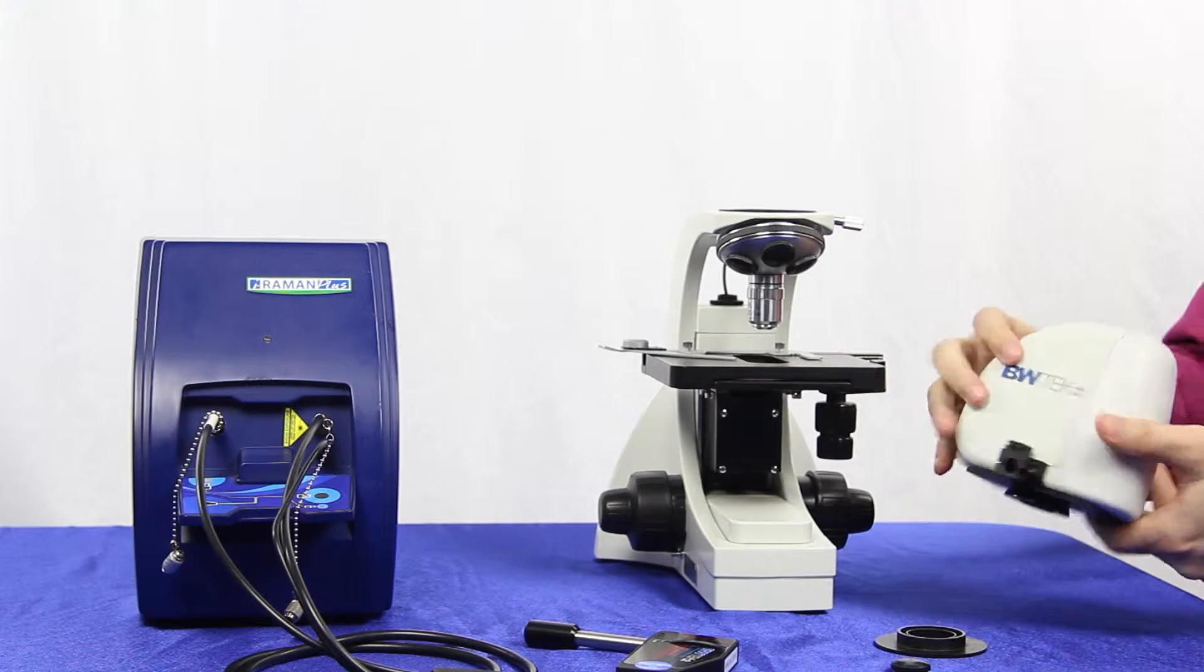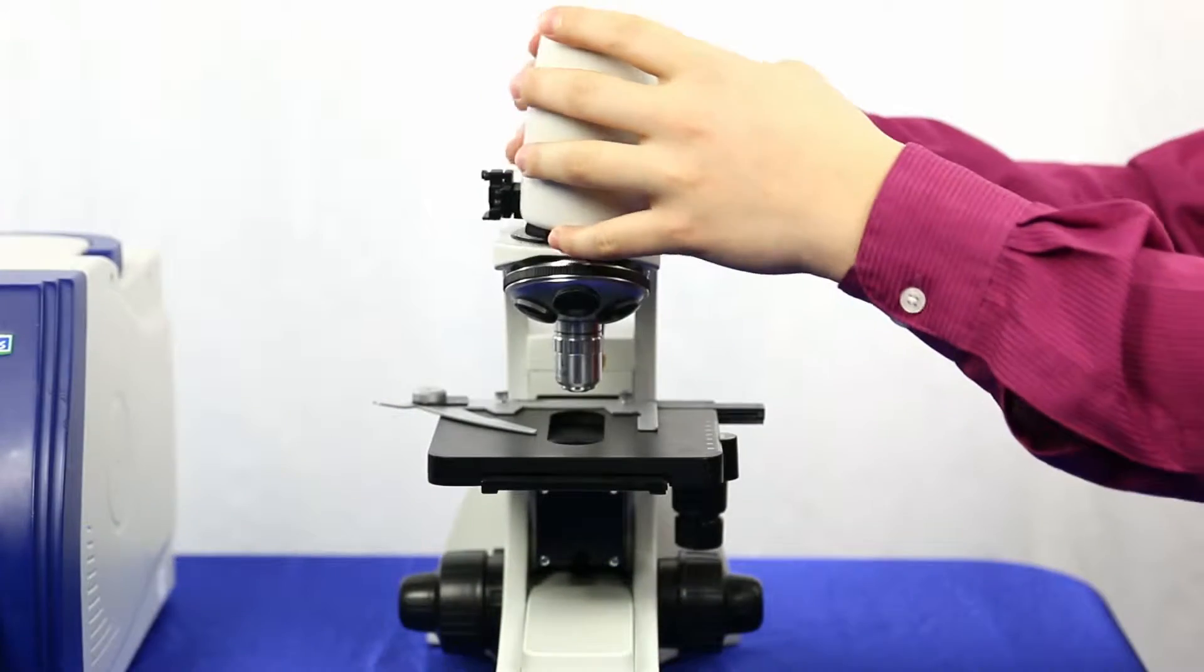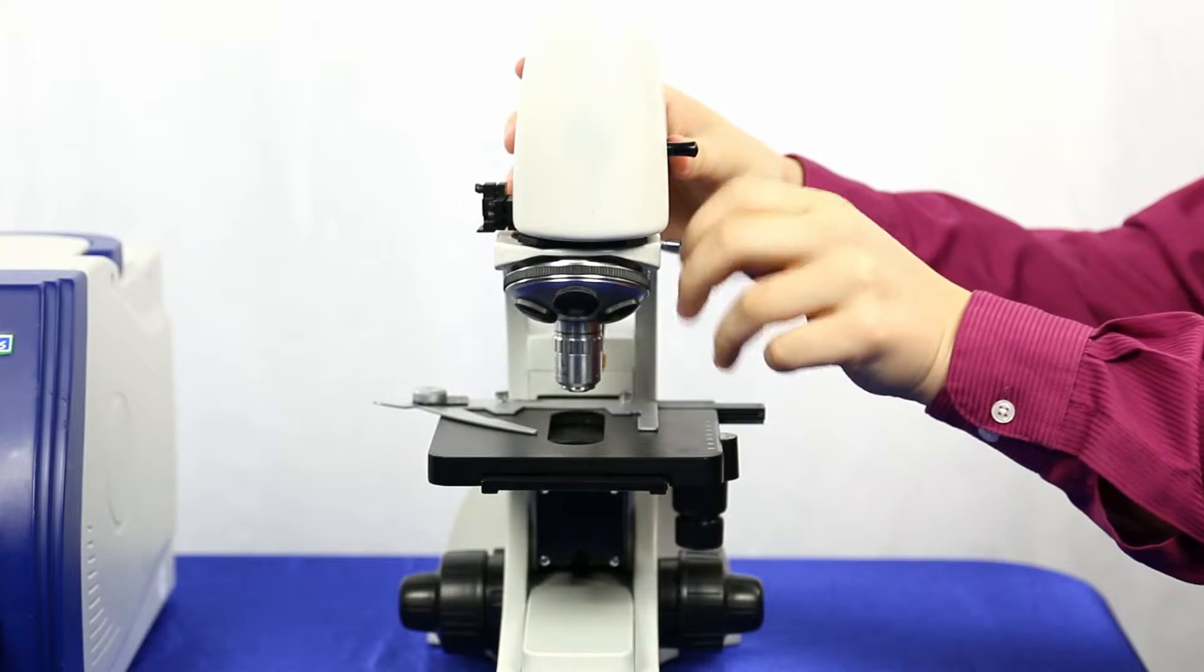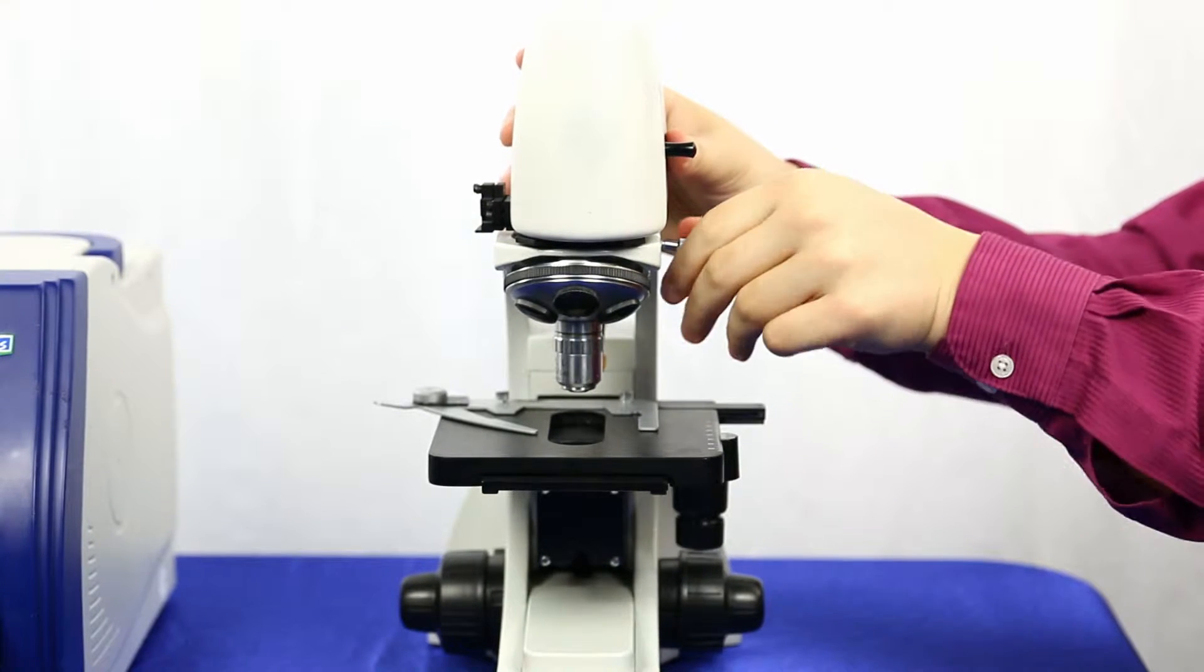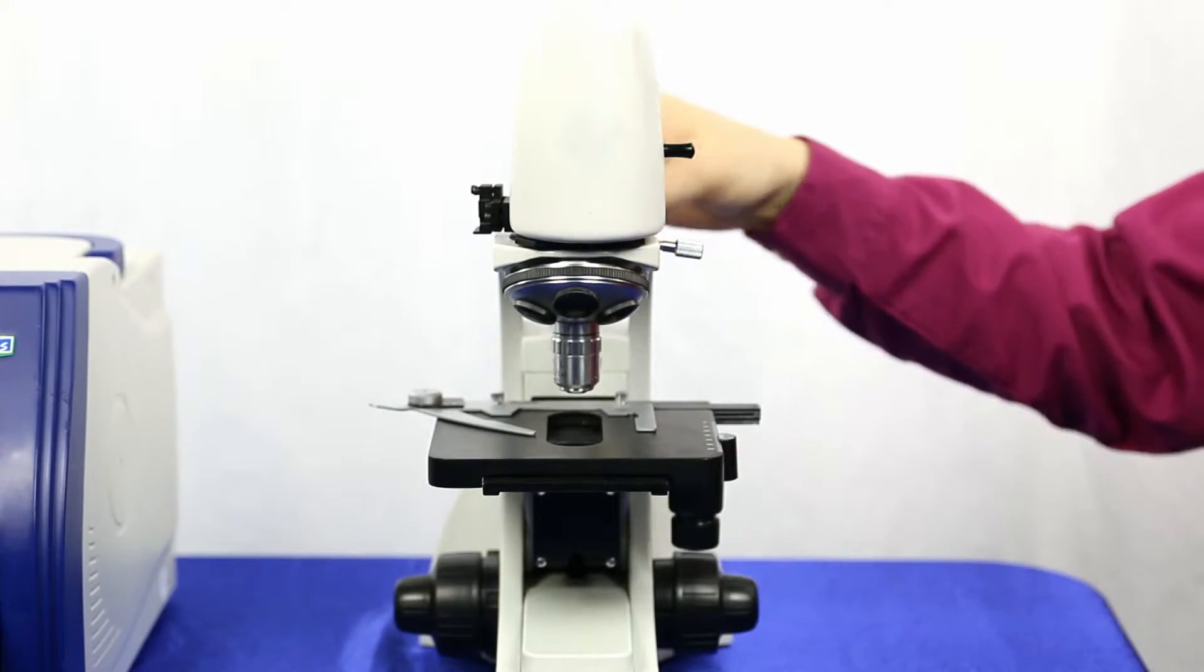Then you'll want to take your microscope head and put it onto the body and screw this in to make sure it's firmly in place.